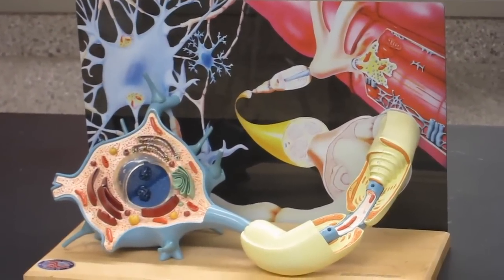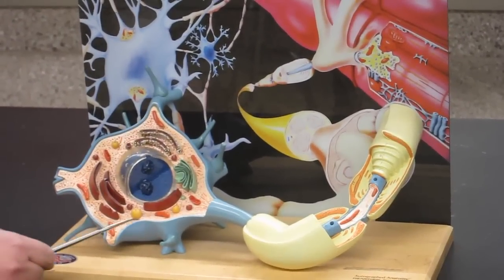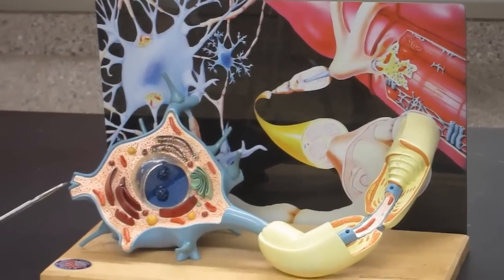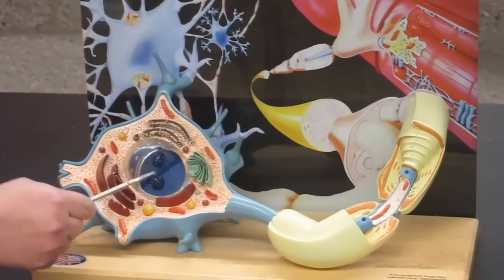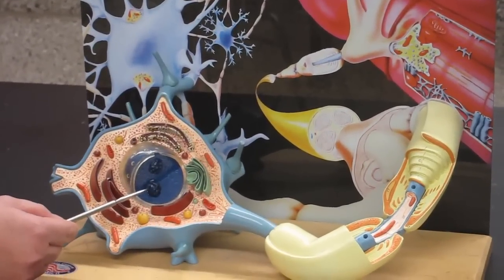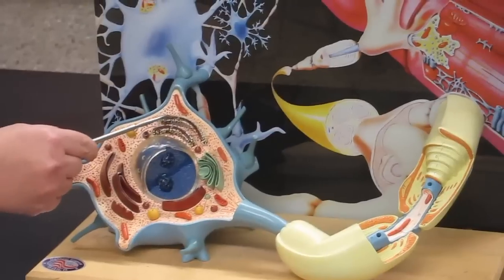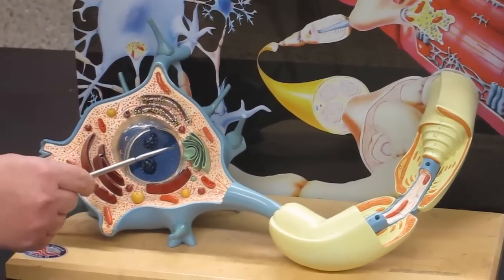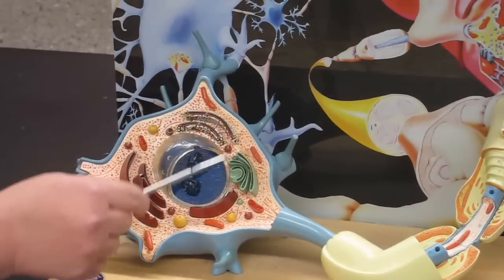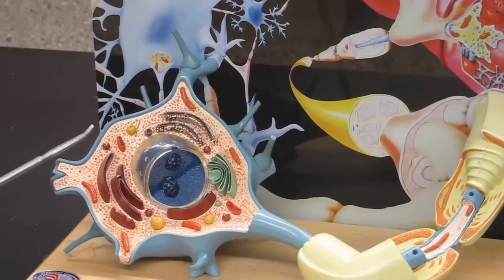In this depiction, we have the cell body well represented here and you can see a lot more of the organelle structure. Here's the nucleus with nucleoli in there. You can see a nice representation of the rough ER here, a Golgi apparatus, and mitochondria. So it really looks like a cell in here. You don't see as much of the dendrites.